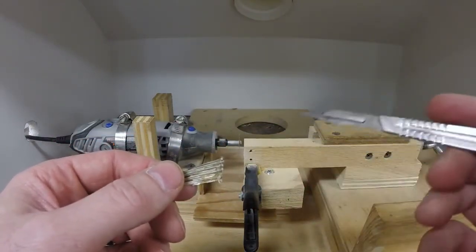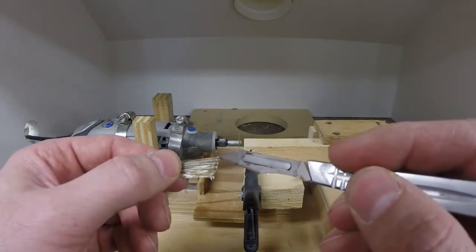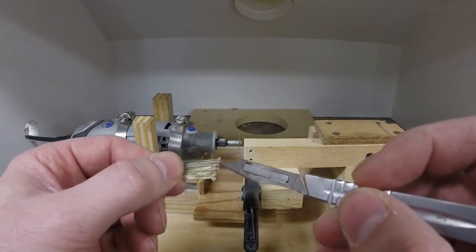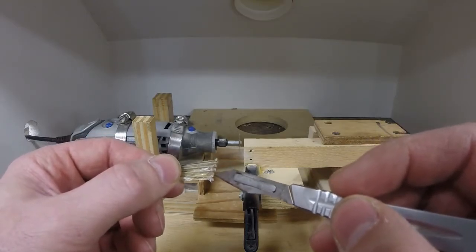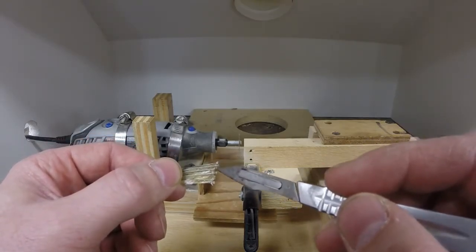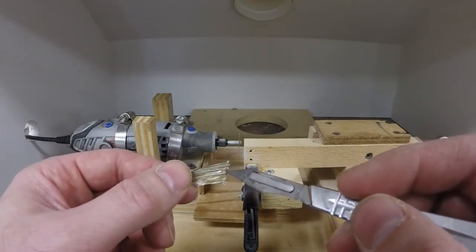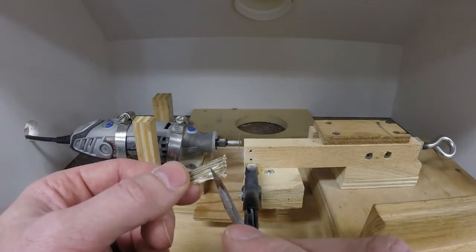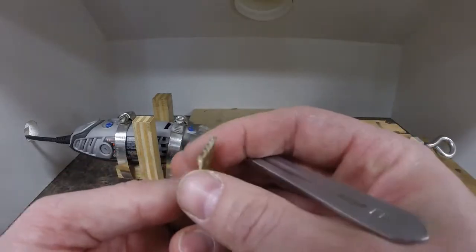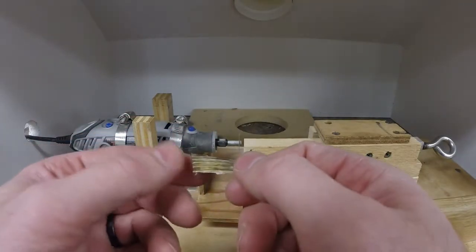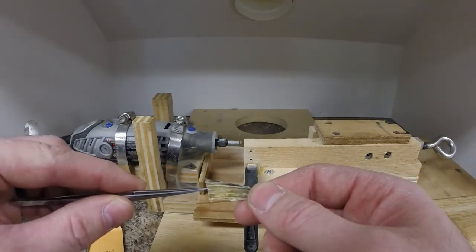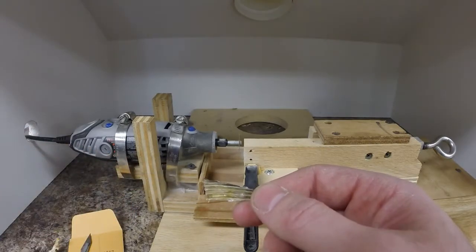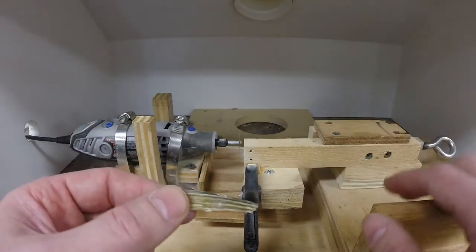This one's fairly flat on the bottom. If you're careful when you put them in the envelope when they dry, you can keep them like that. But sometimes they form sort of a big triangle shape. When that happens, I take the first cut so that it's even with the bottom of the third ray. That way I'm getting a cut that's as close to the bottom as possible to the primary ray that I want to age. If you were just to come up and square the whole thing off, you end up with sections that are farther up the fin rays, and if you do that, you can miss out on annuli. So not too much an issue with this one being flat, but what I will do with this one is the first cut I'll set up so that it cuts basically at the bottom of the third ray back, right in this area. And then I'll do the same as what I did with the maxilla, which is half a turn, three quarters of a turn, five eighths of a turn.